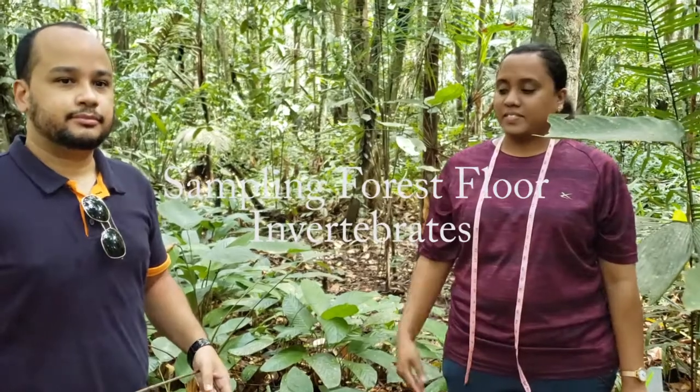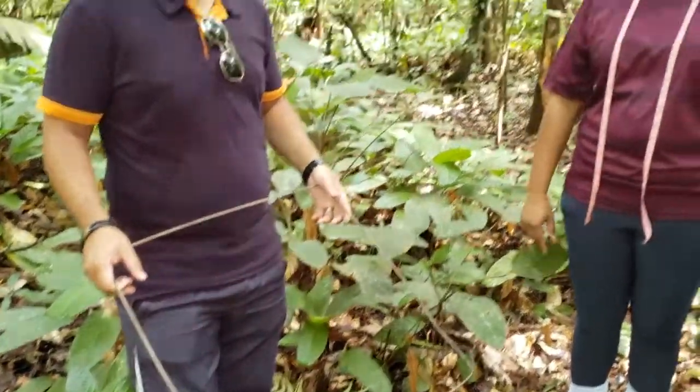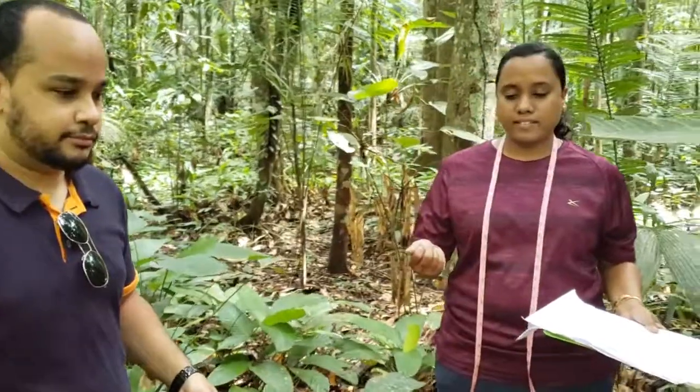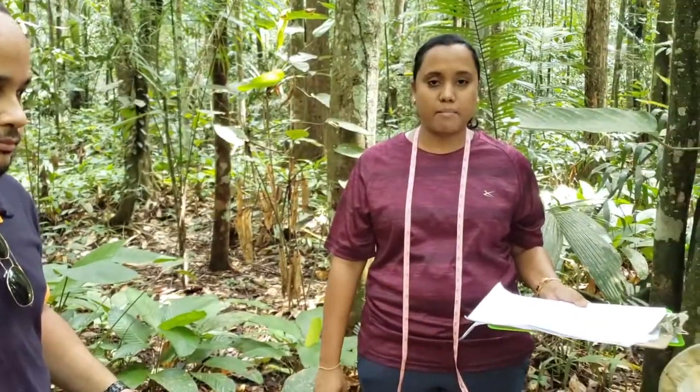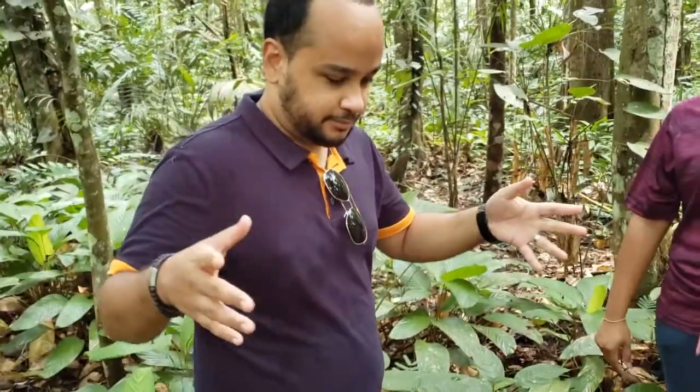Go. So Ranoa here would randomly lay the quadrat anywhere along the transect so we could have a look at the soil conditions as well as do some sampling for the animals, soil invertebrates. Randomly.